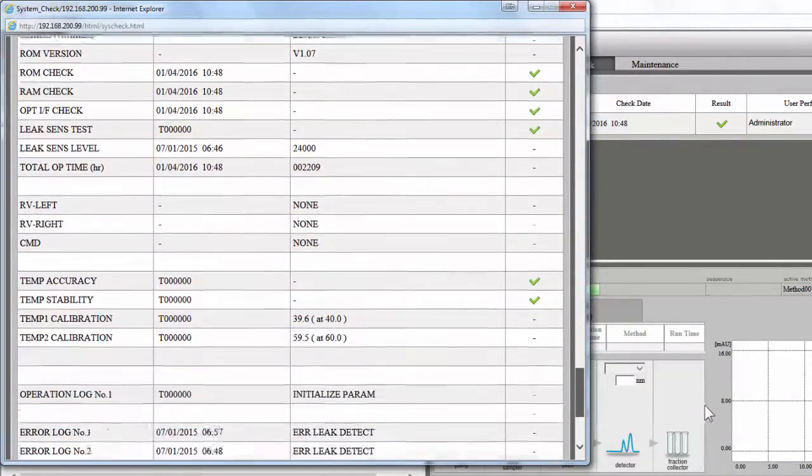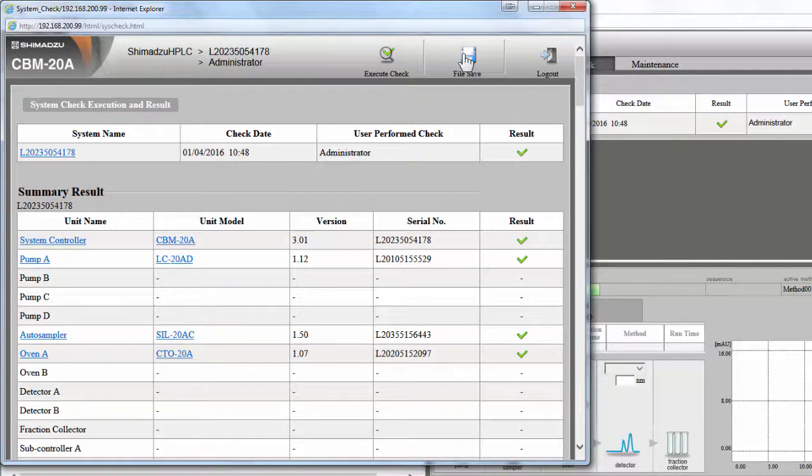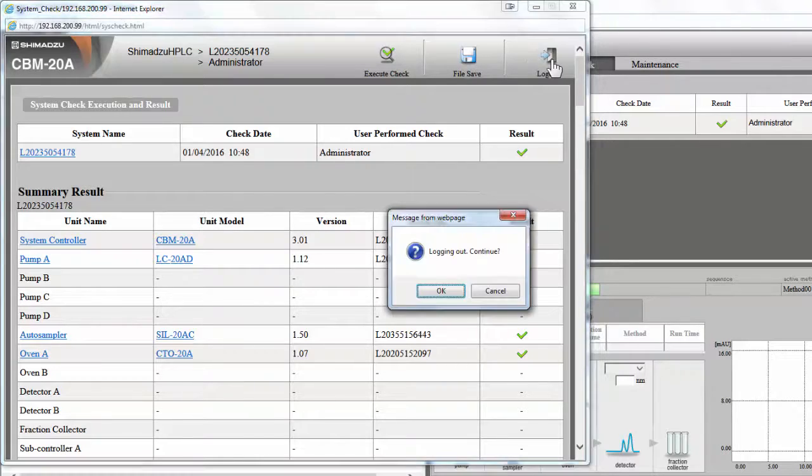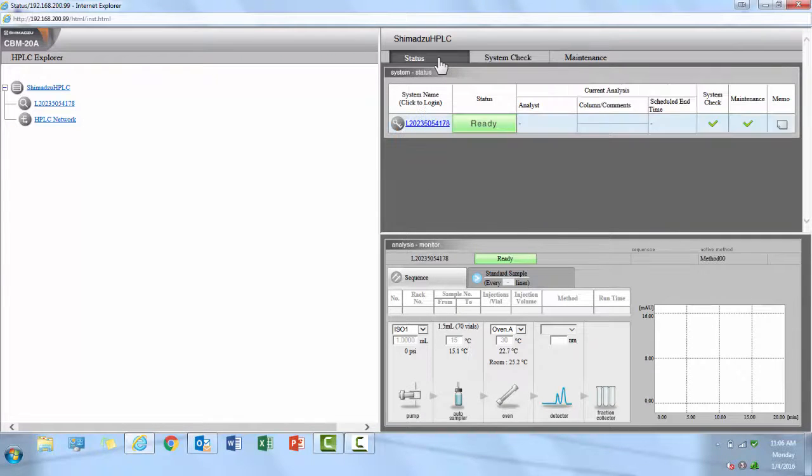Once the system check is complete, you have the option to save the result as a .csv file. This can be useful for your own records or when contacting Shimadzu for additional support. In addition to the diagnostic functionality of the web interface, it also allows for direct control of the hardware in the same fashion as Lab Solution software, with the caveat that you are unable to save any of the data.